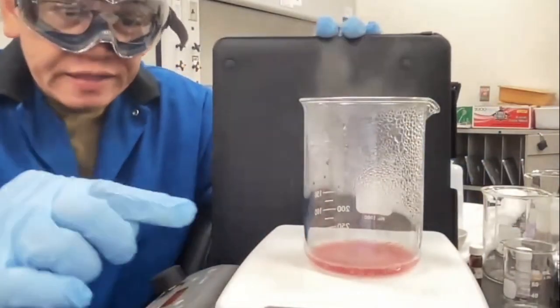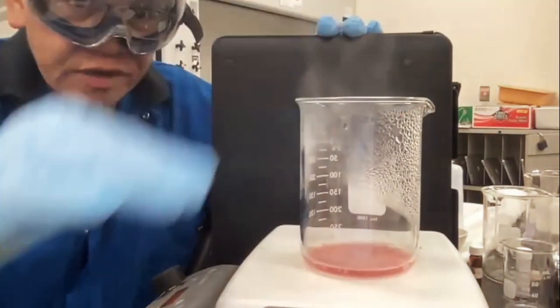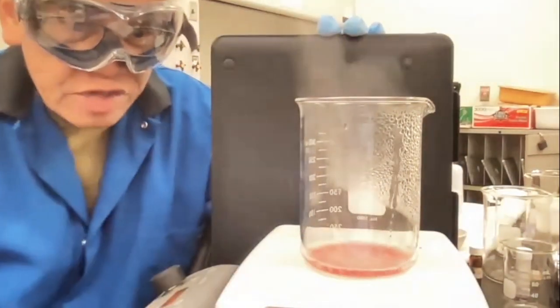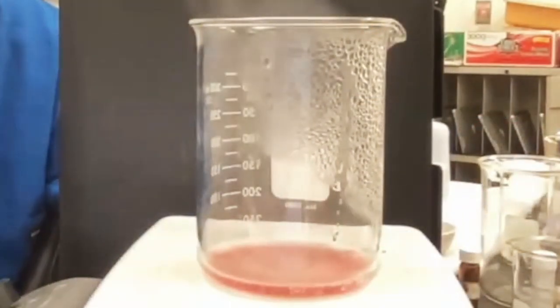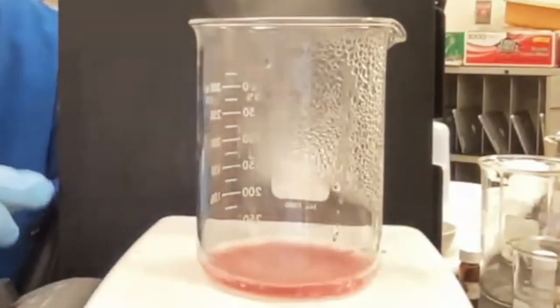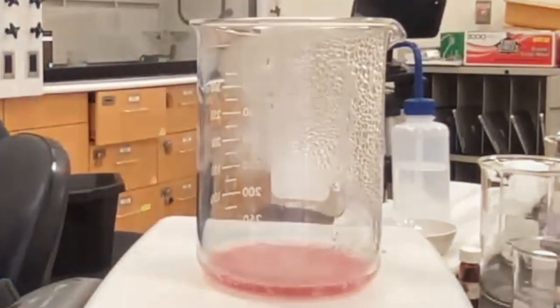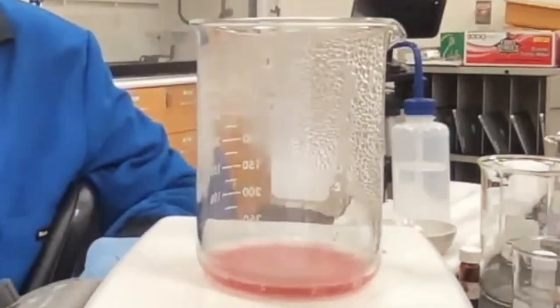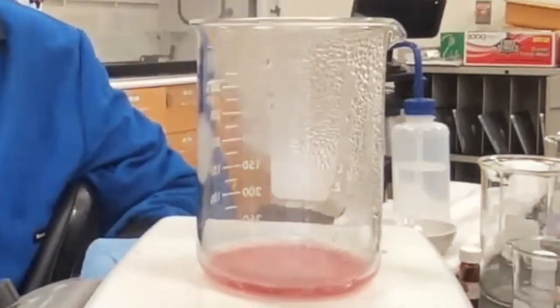You can see right at the edge where the water starts to go into a gas, you can start to see some blue coloration, okay? And that's because some of C is turning to a solid on the side because there's no water there. But now we're at the critical point. Now we're to the point where the last bits of water are evaporating. And again, it's important to see what the transformation looks like.